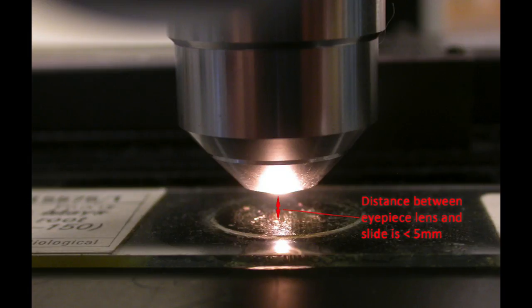The two surfaces will almost be touching when using the 40x objective and that tiny distance between them will be just a film of oil when using the 100x objective. Try to remember this when, after placing a slide on the stage, you want to begin to find where to focus.